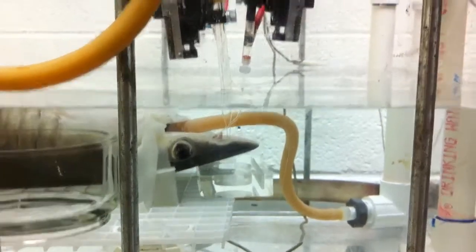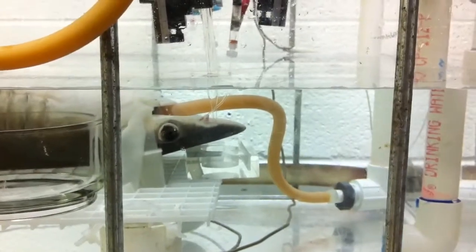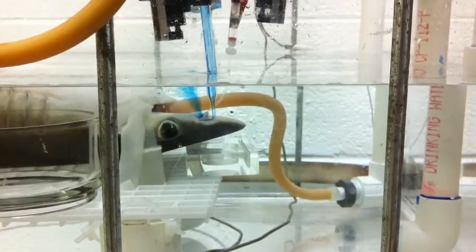So if I inject this dye, you can see the flow through the nose, like where the odor would travel, theoretically. So I'll just inject a little bit. Whoa, there it goes.